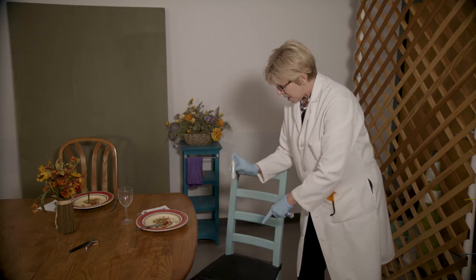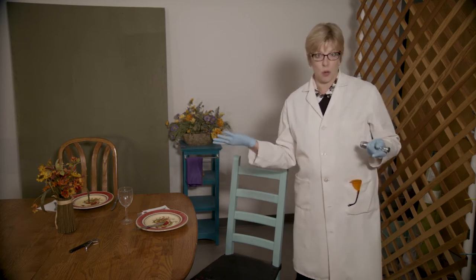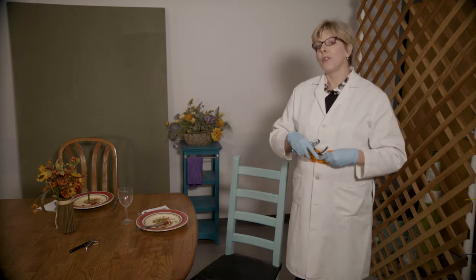And it looks like there's some staining on this chair. The flashlight is great, but a flashlight only produces white light, which only has so much power. So the use of an alternate light source — which you've probably seen on TV represented as a blue light, black light, or UV laser — is often used with these cool orange glasses, these barrier filters. This alternate light source produces a different wavelength of light that will help the scientist better visualize evidence.